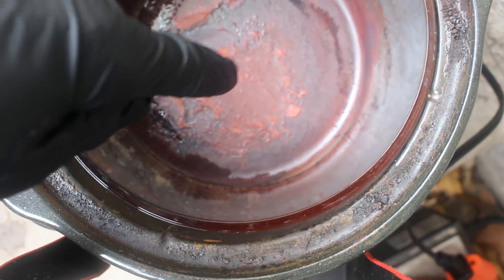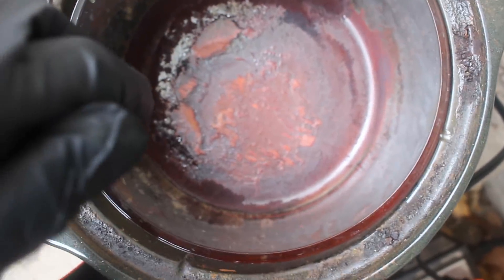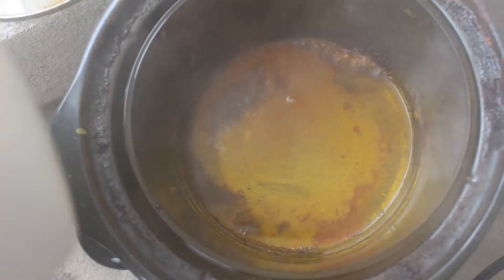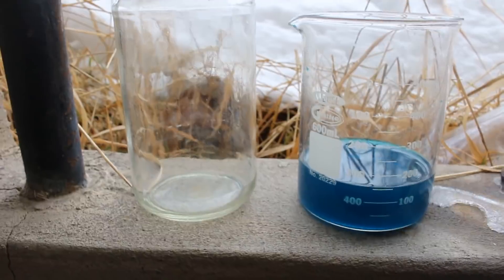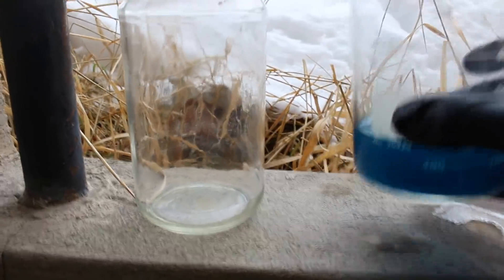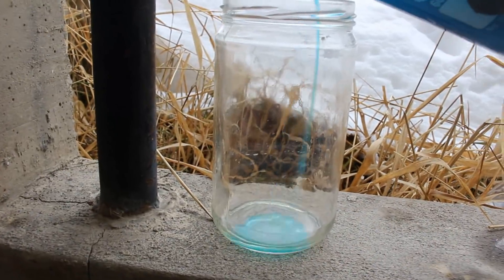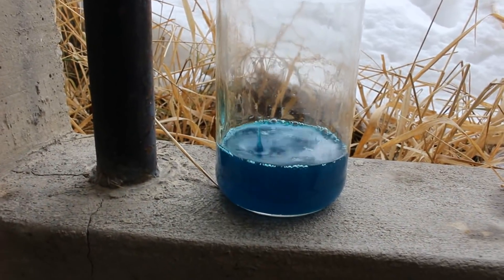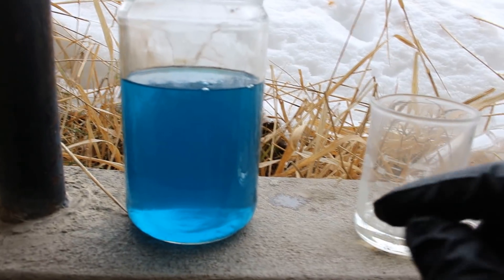It's the next day and this has been dried out, so hopefully there's no nitric in there. Hopefully I didn't get it too hot and bake the gold out. Looks like it's all dissolving. Right here is the solution that I poured off of the gold — this contains all of the copper and hopefully the silver. I need this beaker, so I'm going to transfer it into this other container, and let's dilute it with a bunch of water and precipitate the silver out.